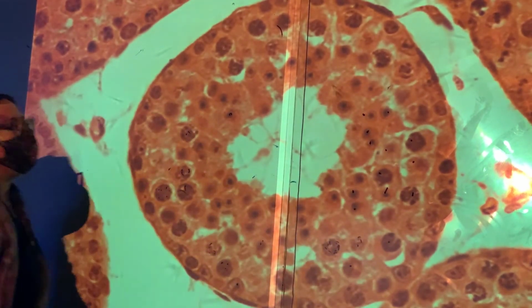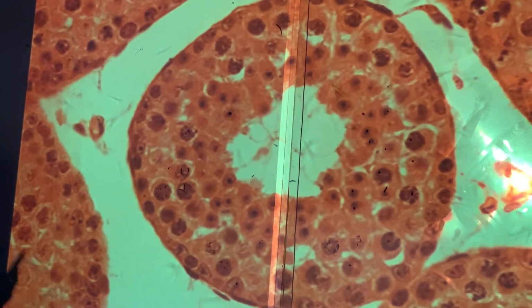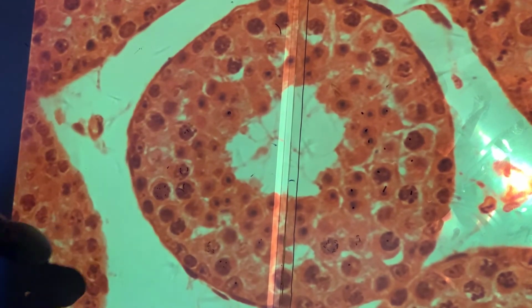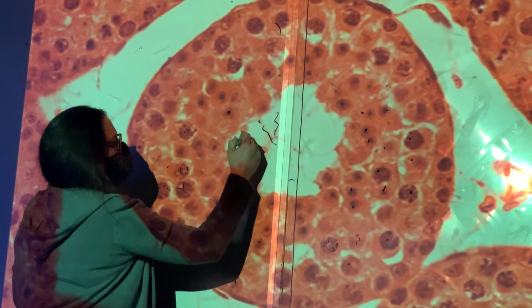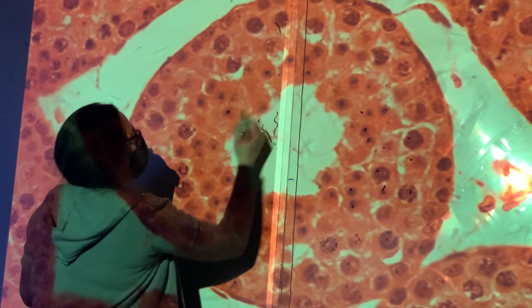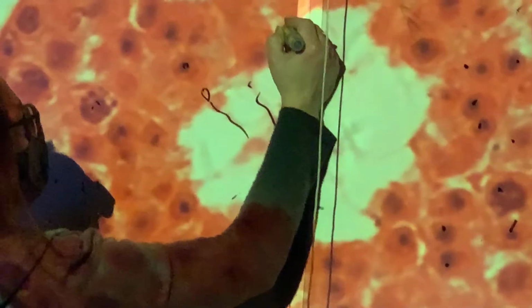They're just all over. So when I look at that, I say, oh, that's got to be the testis. It's got to be the seminiferous tubule. I get cells in all different stages of cell division. What you're seeing out here, this stringy stuff, those are sperm tails that are hanging out in the lumen. What you can't see, because they're too small, is their heads still in there, attached.